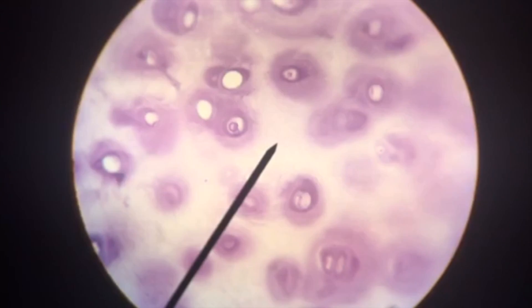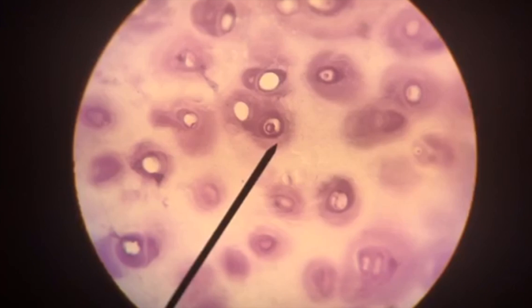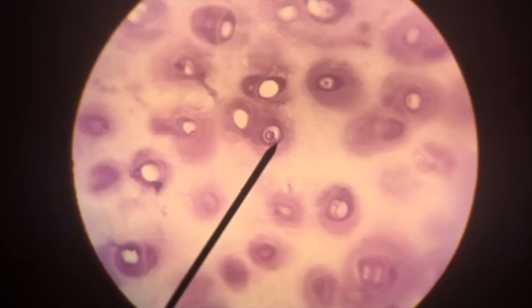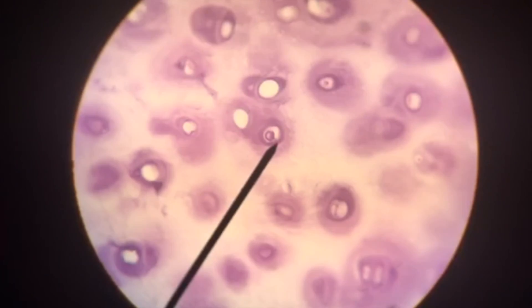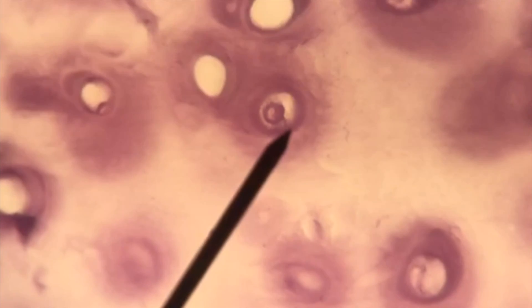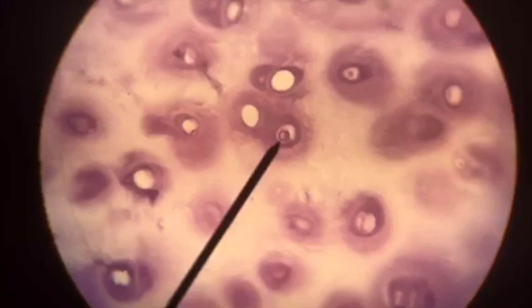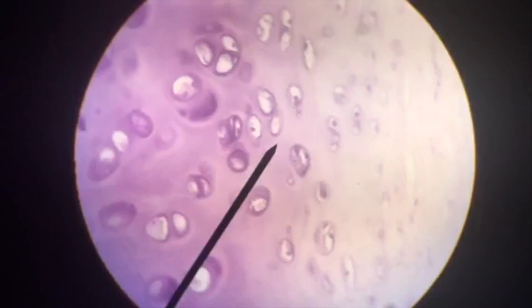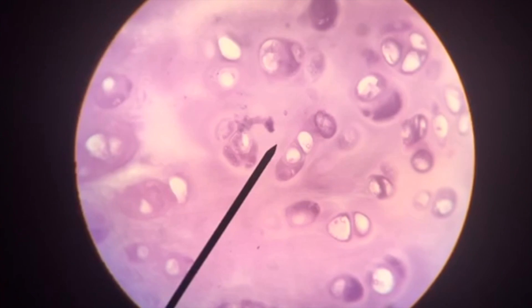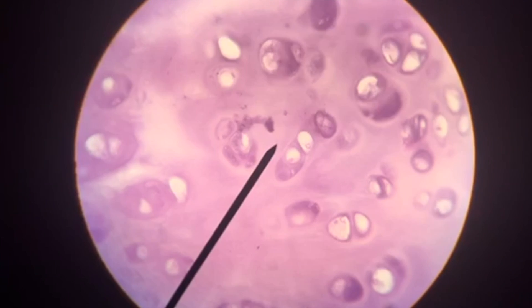We're going to shift to our third category of connective tissue and look at three types of cartilage. The key is to understand that the fibers located in the matrix are going to help us identify them. The structures we're pointing to — called lacunae — are divots consistent through all three cartilages. Within those lacunae are specialized cells called chondrocytes. The key to identifying this first cartilage — hyaline cartilage — is in the matrix. Notice the matrix is solid pink, with very few collagen and elastic fibers. This is a nice example of hyaline cartilage found in the trachea.